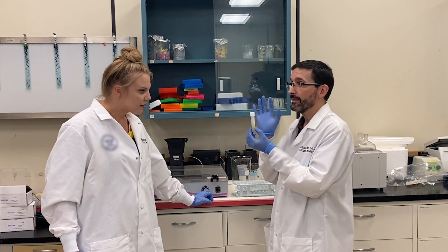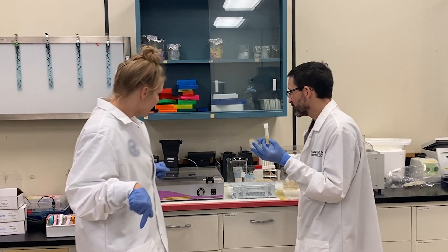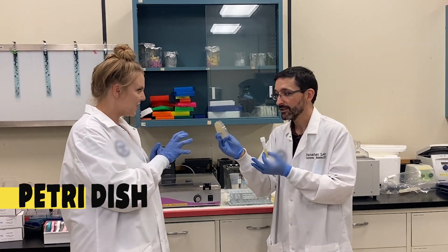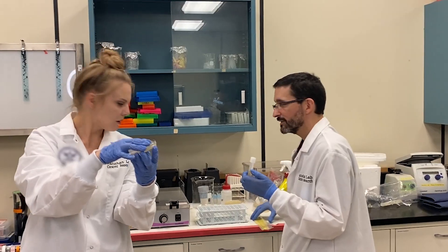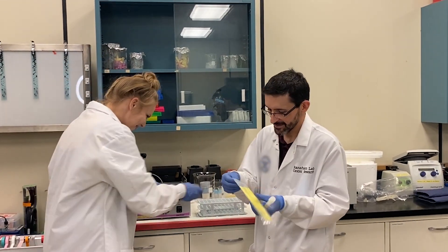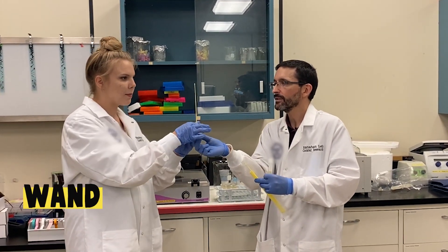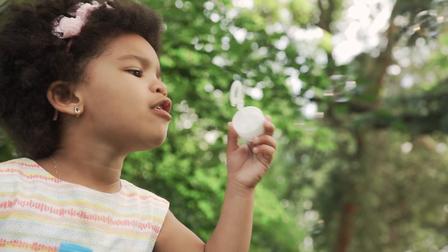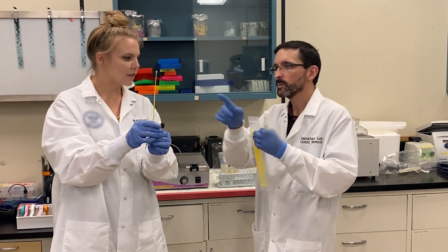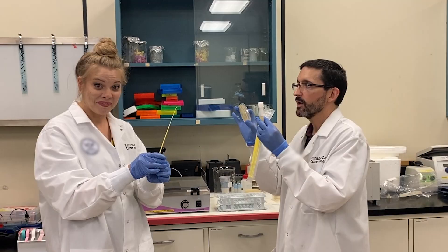Okay, so there are actually cells in here. They're very small and very special because their DNA glows. So what we're gonna do is a little art project here. This is your canvas — this is a petri dish. There's a very special gel on there and that gel will help these cells grow. I have some interesting art brushes for you — they're called wands. It looks like a bubble blower. And what that's gonna do is help spread these cells onto this plate. Whatever designs you come up with, you can do, and then we'll make it glow.